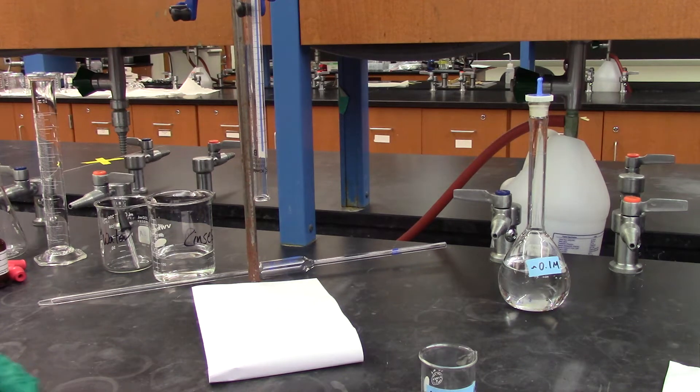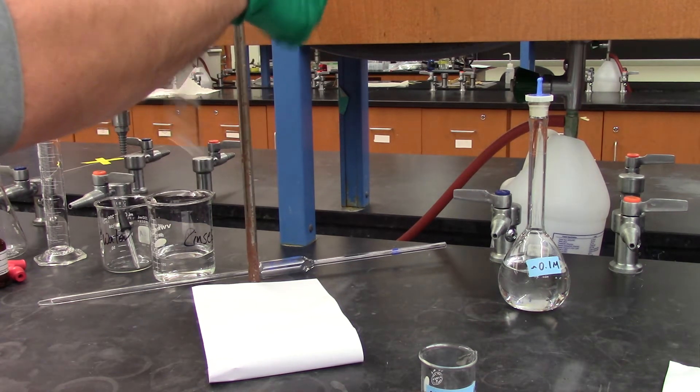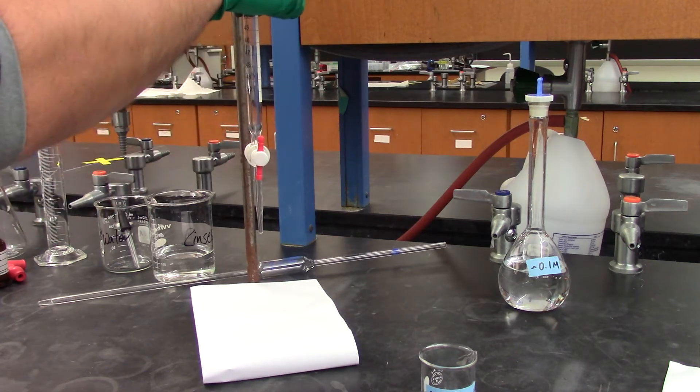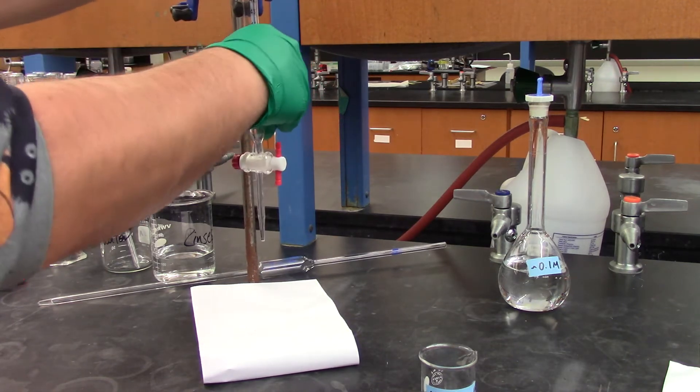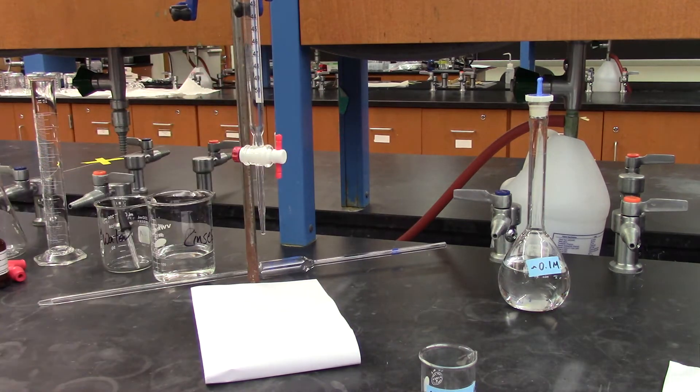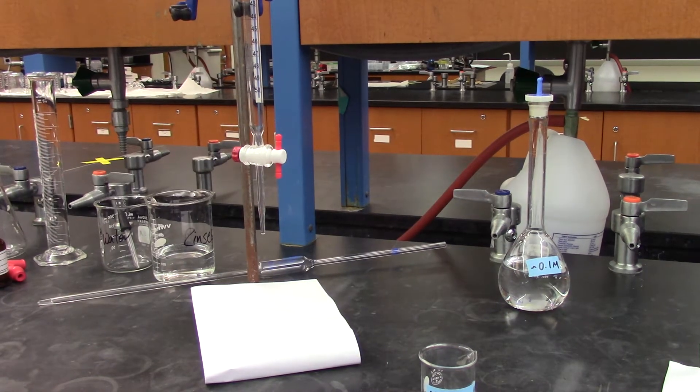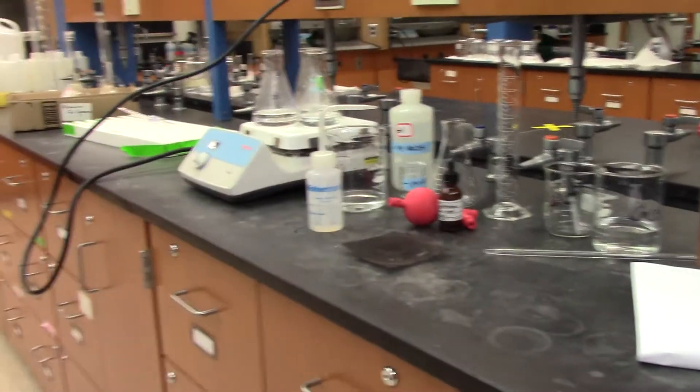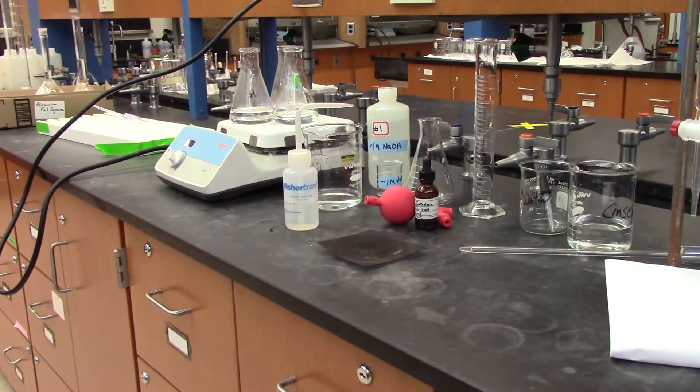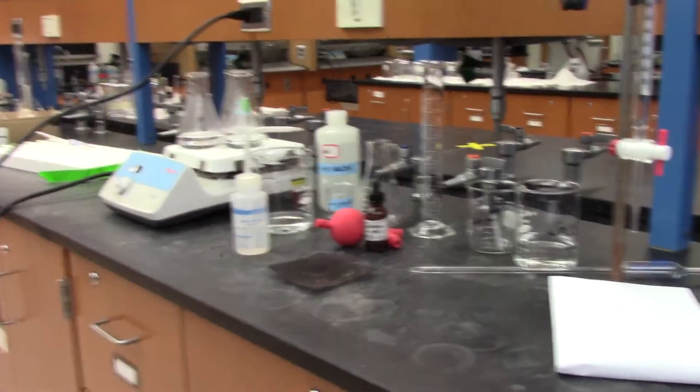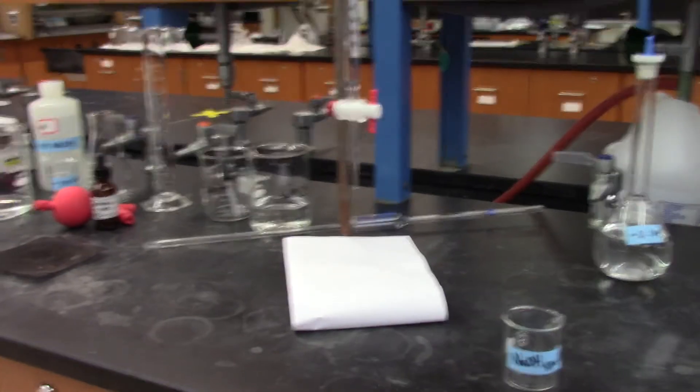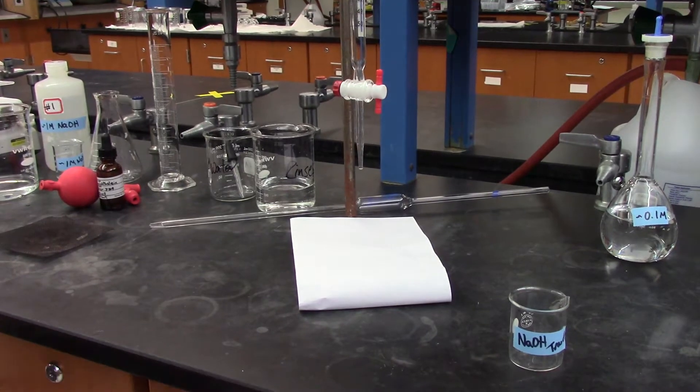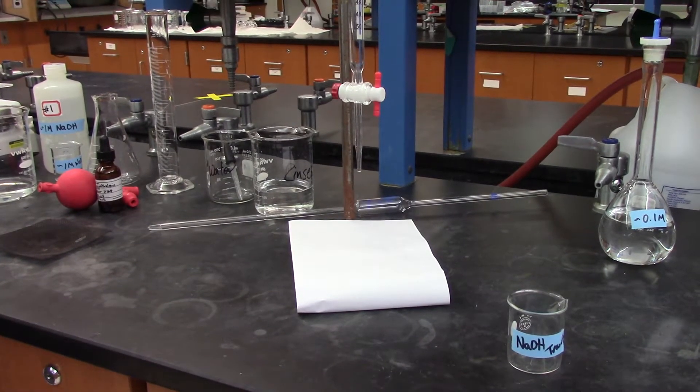All right, so here we'll be preparing the burette for the titration of our KHP, which I'm going to have warming right over here. So while that's warming and dissolving in my titration flask, I'm going to prepare my burette.